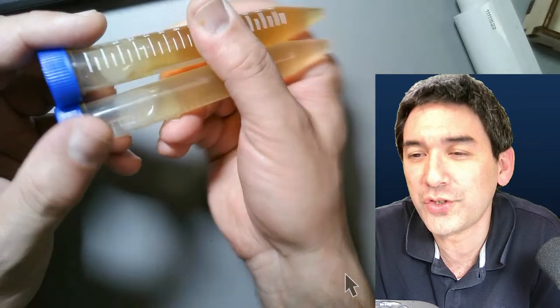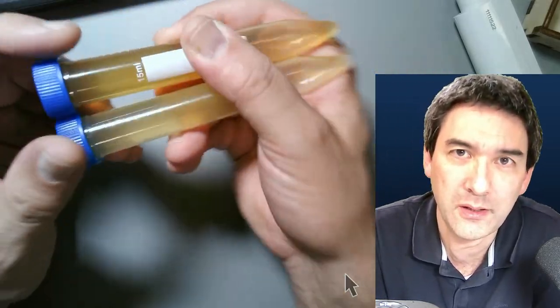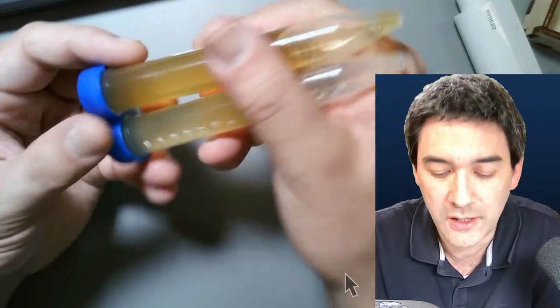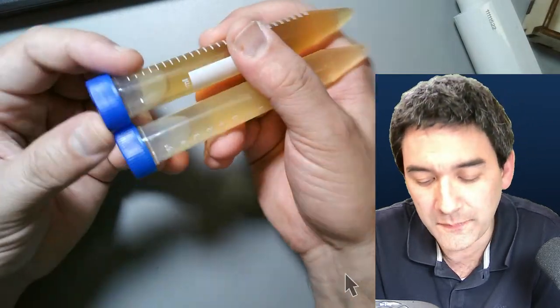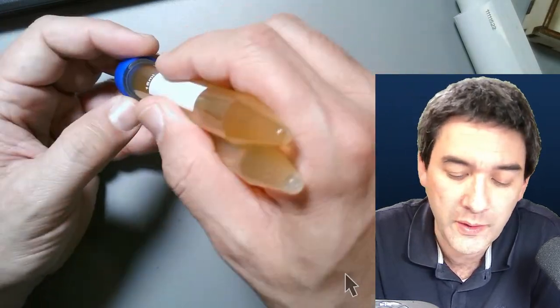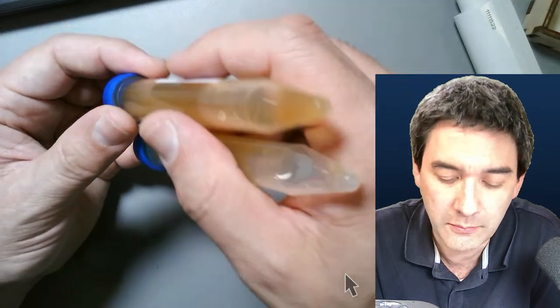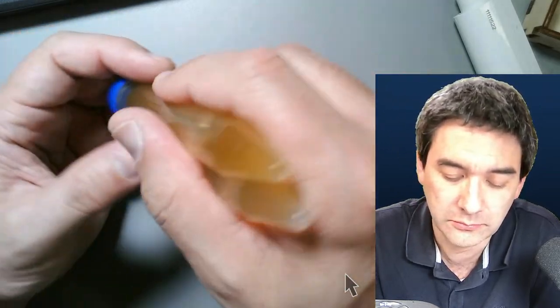How do you clean the test tubes? Is it possible to find a honey particle next time you use the same tube? These are disposable centrifugation tubes. When doing real lab work you would throw them away after use. For our hobby purposes, if you rinse them out properly it's going to be fine. There might be some particles left, but if you rinse them they'll be so few they shouldn't disturb you under the microscope. If something becomes dry and stuck in there, then you just throw it away.